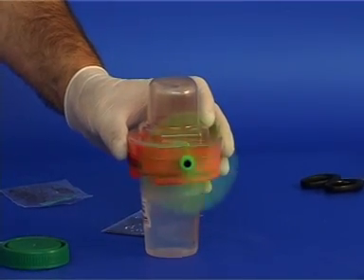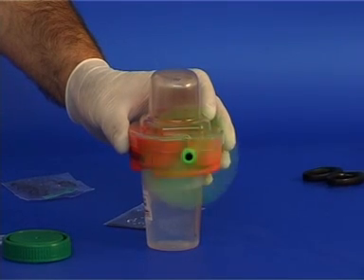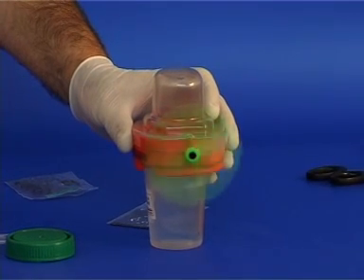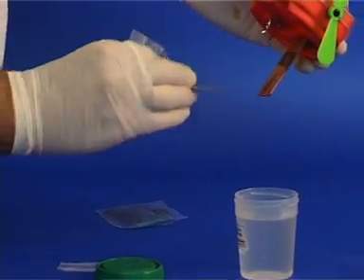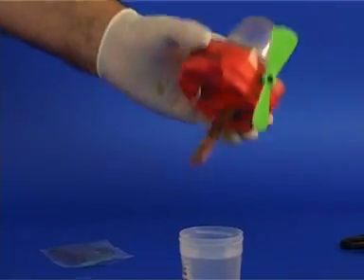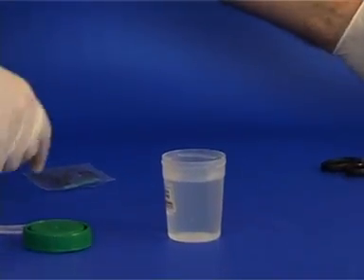Eventually, the magnesium will be consumed and the propeller will stop turning. After you have finished the experiment, remove the excess magnesium from the alligator clip. Clean and dry the other electrode for future use.